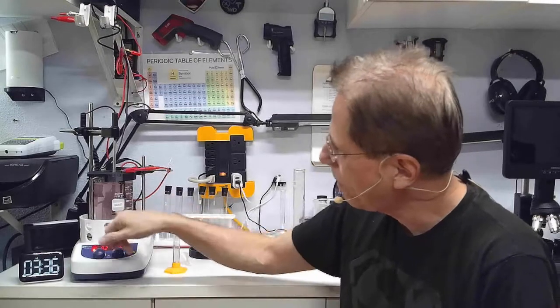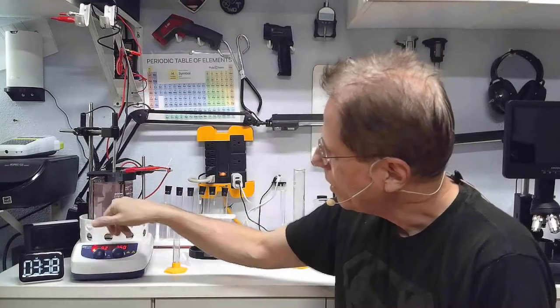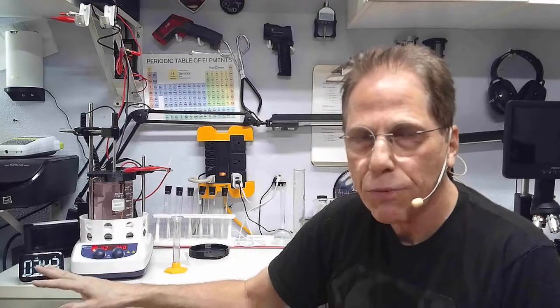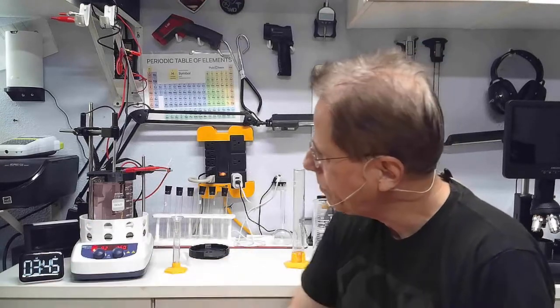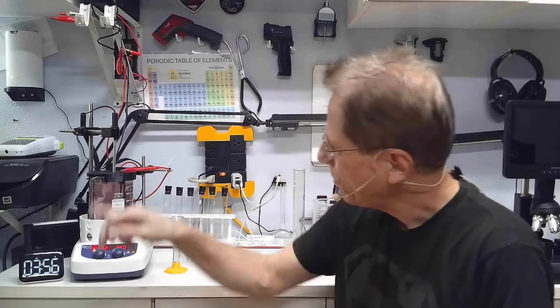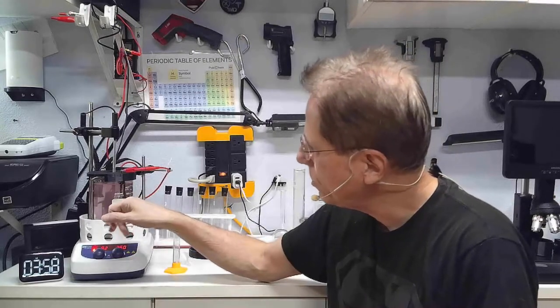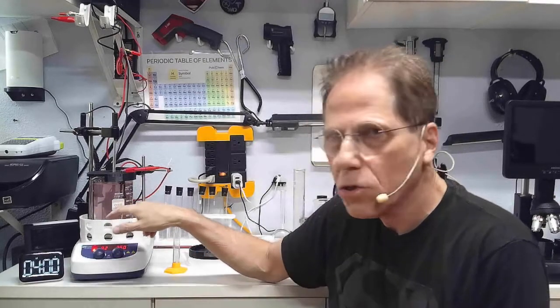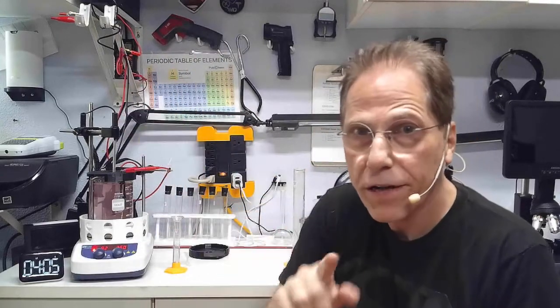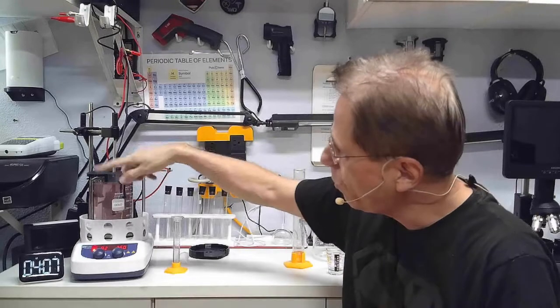I am timing the process, so I stop it at 20 minutes. If you're not sure and you don't want to overcook your colloidal gold, I would wait until you start to see this get a little bit darker than what you got here, and then I would turn the process off. You're going to find something weird going on. This is going to continue to develop and get darker.